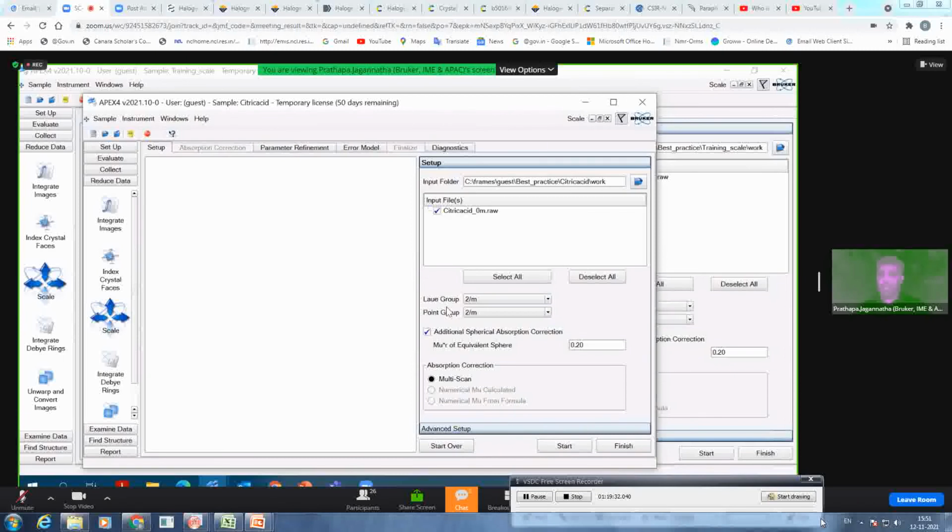Make sure you have a proper Laue group and point group. 99% of the time the software picks up the right one. But if not, you can change the point group here. Make sure, if it is non-centrosymmetric, then use the point group corresponding to your crystal system. In this case, I will leave it just 2/m because I don't know whether it is centrosymmetric or not. The first step, I'll just keep it as it is.